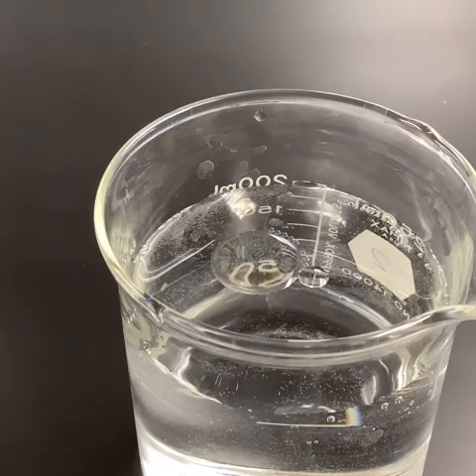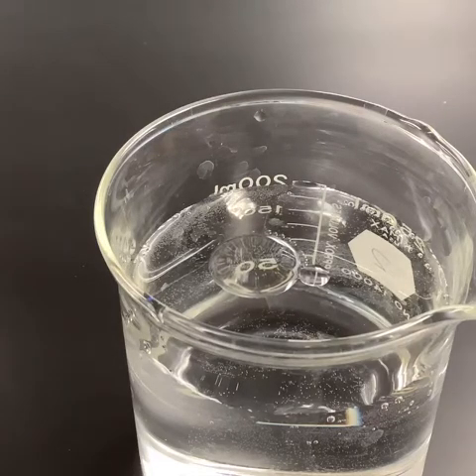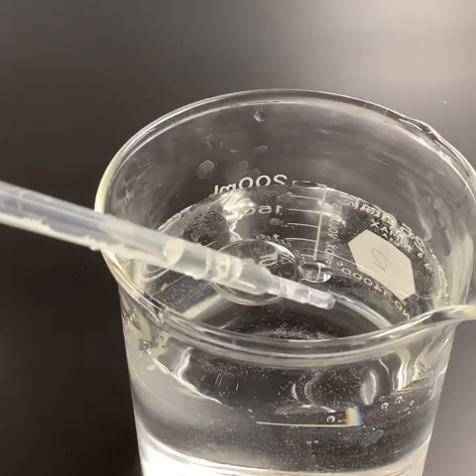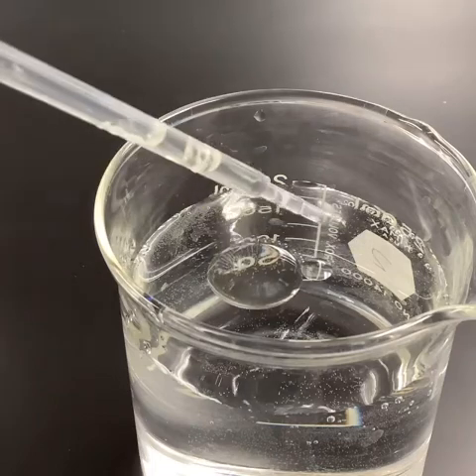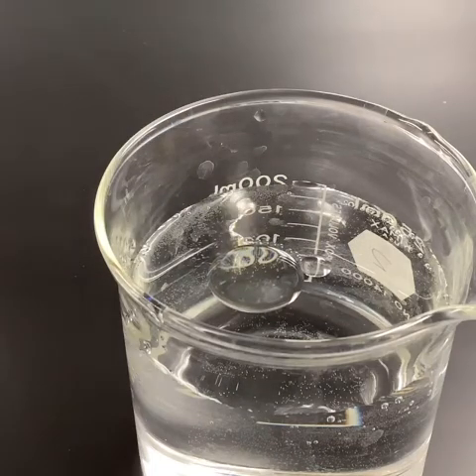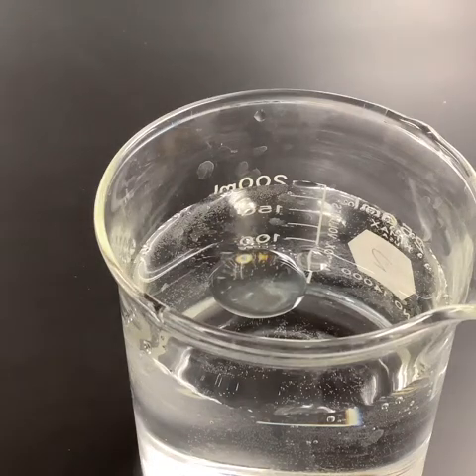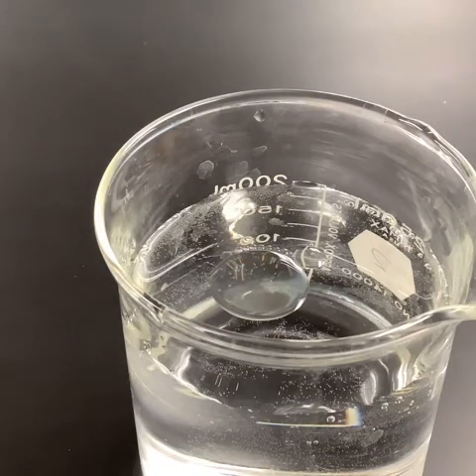Okay, so we see the oil tends to be sticking together quite nicely. You notice that when I put it off to the side, a lot of times it was drawn in. This one's kind of getting stuck right there. But now at this point, it's just pretty much sitting there, just stays right on top.